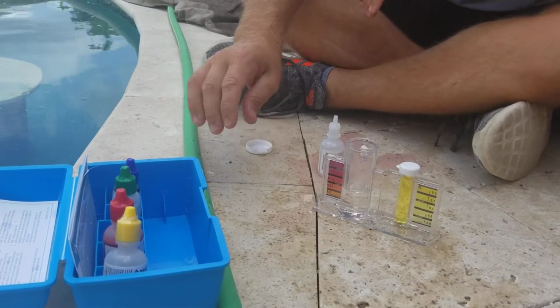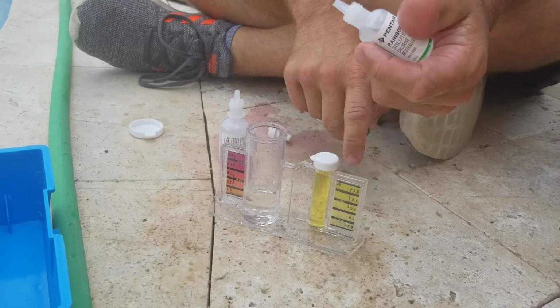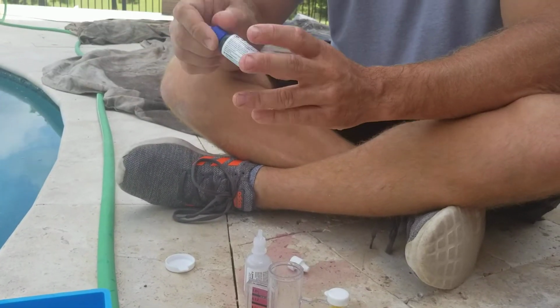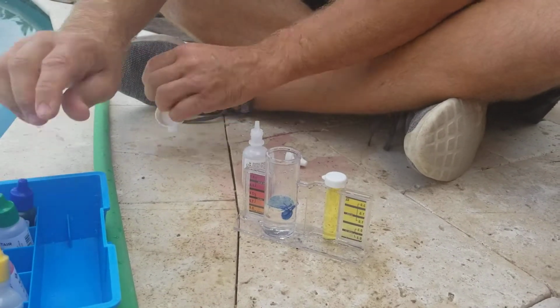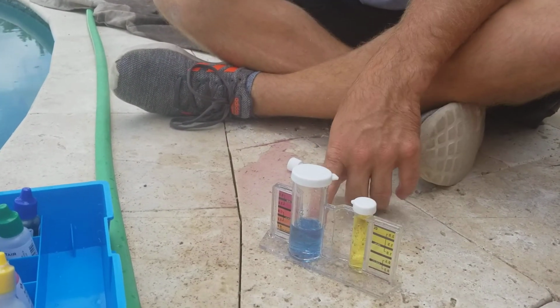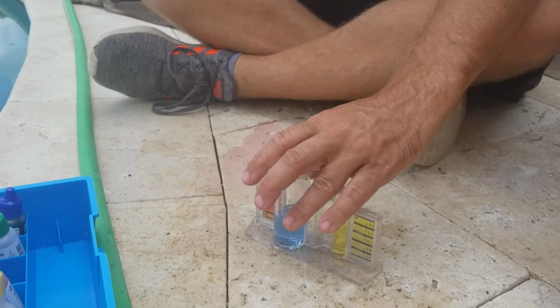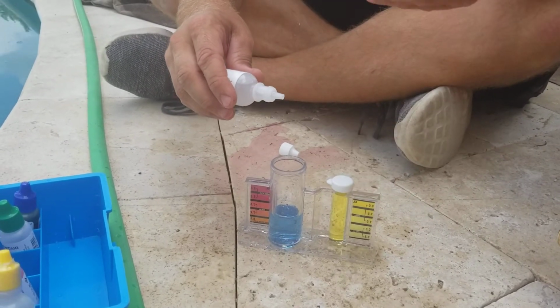On the alkalinity test, same thing. We neutralize it, 2 drops because our chlorine level is above 1.5. Then we'll add 1 drop of solution 5, the blue one. Always 1 with the blue. We'll shake it up, and now we will add 1 drop at a time until this changes to yellow. Then we'll keep that number and multiply how many drops it is by 10. That'll give us our parts per million for the alkalinity. Usually it's about 30 drops out here when I first do startups, and it's supposed to be about 9 to 12 drops.